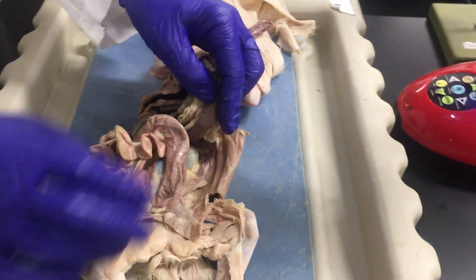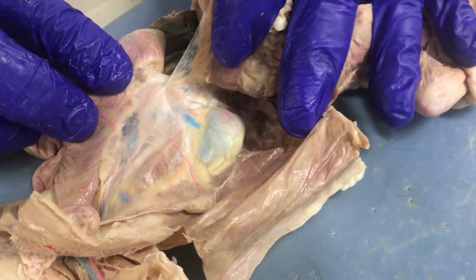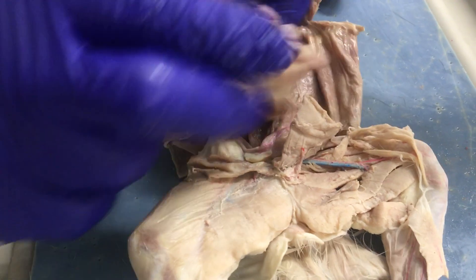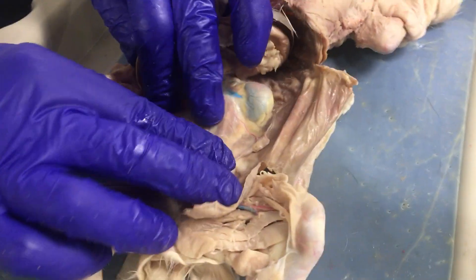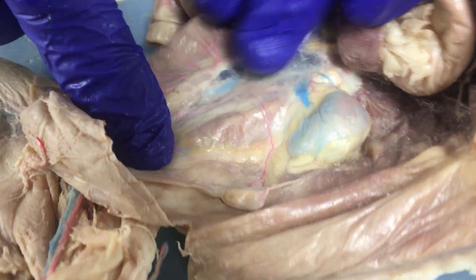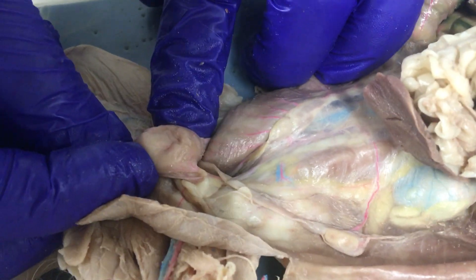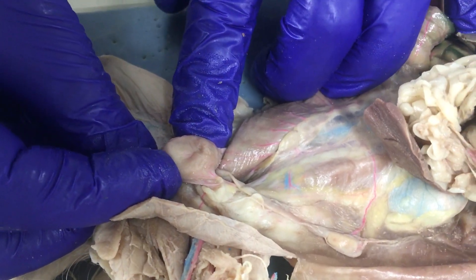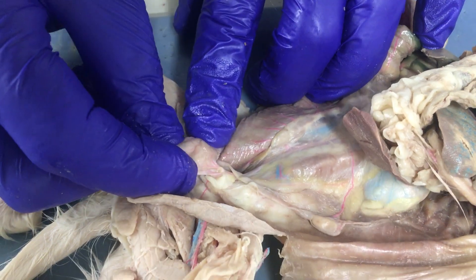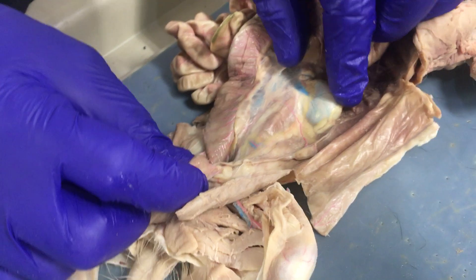The urinary system consists of the two kidneys — the left kidney and right kidney. The ureters are the tubes running down from the kidney to the urinary bladder. Here's the urinary bladder in this cat, very small — it could be much larger if it had been full of urine when the cat died.